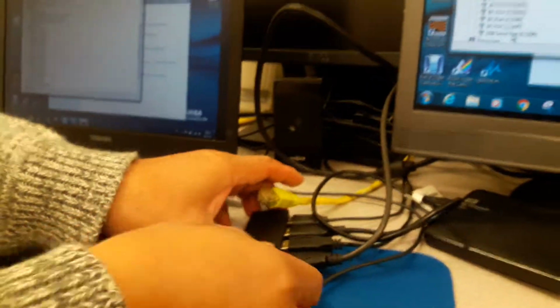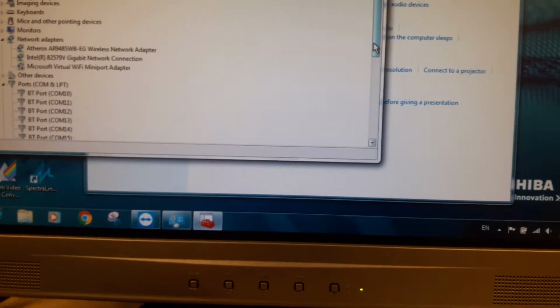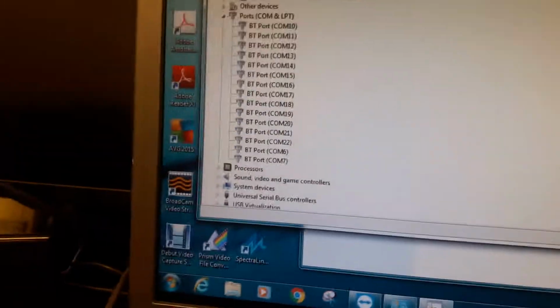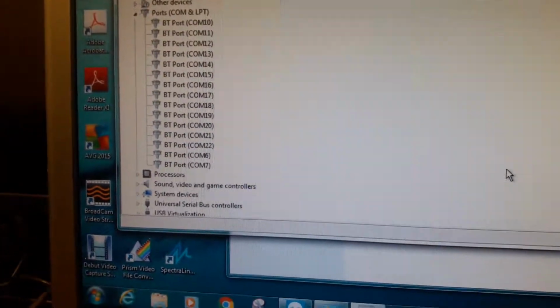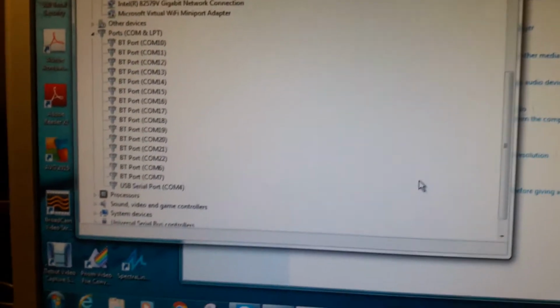And Daniel will demonstrate that this is indeed COM4 by disconnecting that particular device. Why don't you go ahead and disconnect it, and you will see the COM4 will disappear. Now go ahead and reconnect it again. Here, I'll use it with the mouse, don't worry. Now you can see the COM4 has appeared again. So we know that the device is connected in the on position.